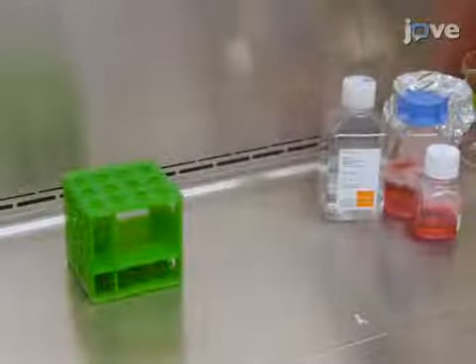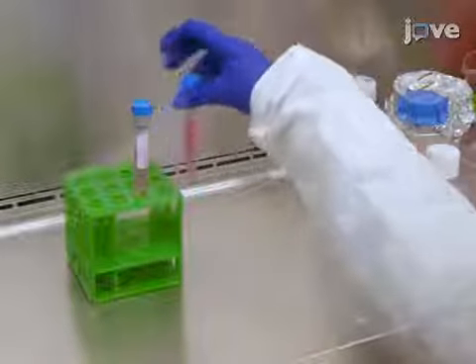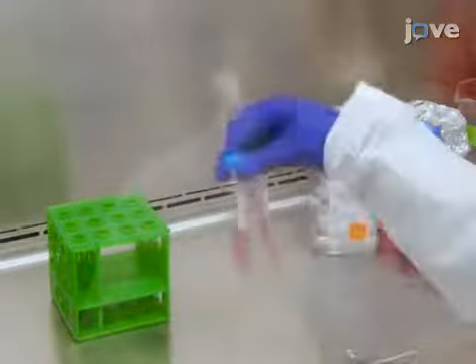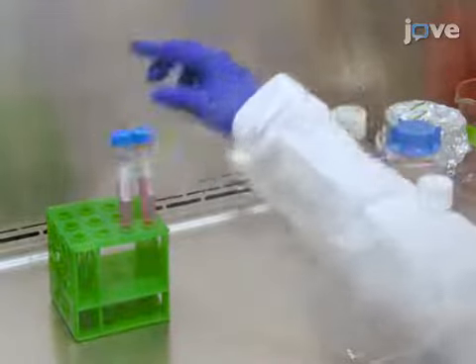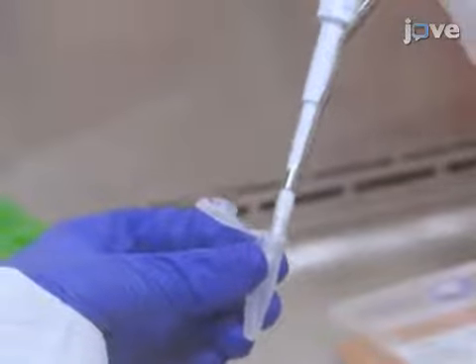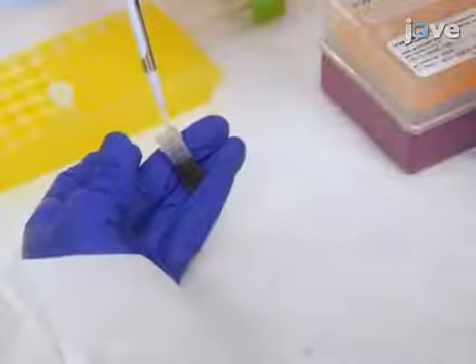To begin, after preparing cell suspensions in tubes according to the text protocol, invert the tubes to mix the cells in solution to standardize seeding. Then pipette 10 microliters of each cell suspension into a microcentrifuge tube and add 10 microliters of trypan blue.